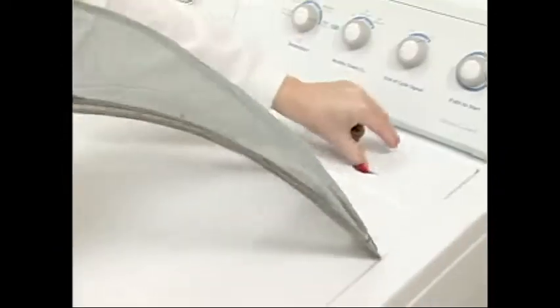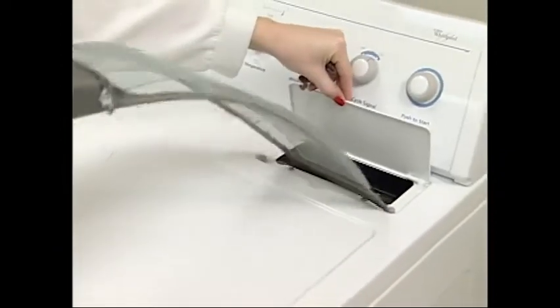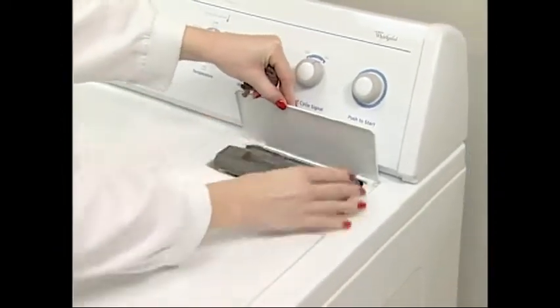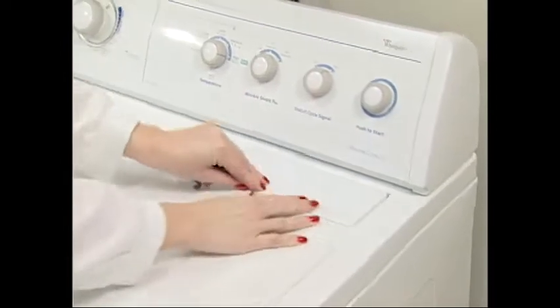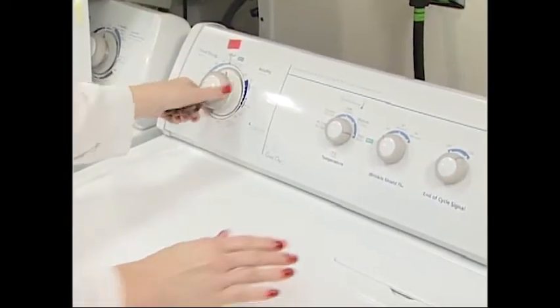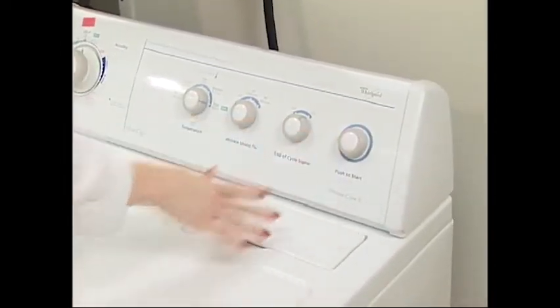Set the dryer for the timed dry cycle at the 30-minute setting. It may be necessary for some heavy fabrics to tumble dry for a longer period.